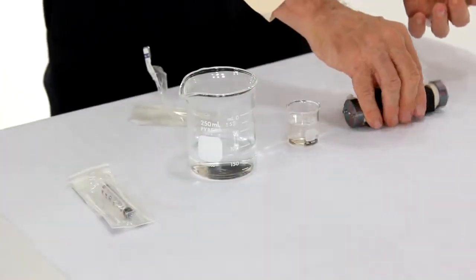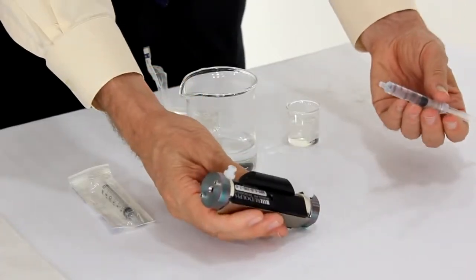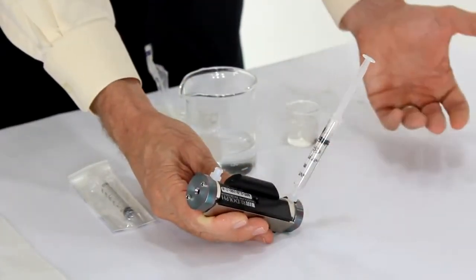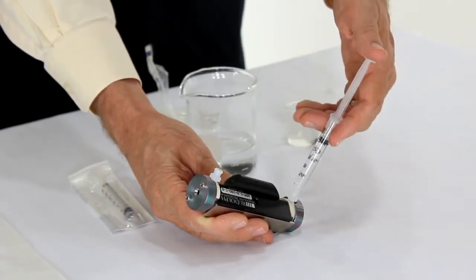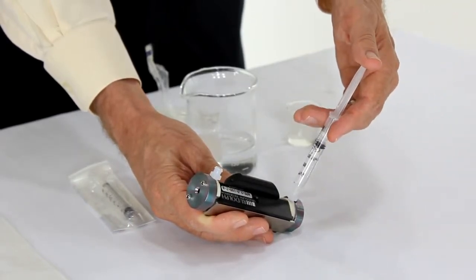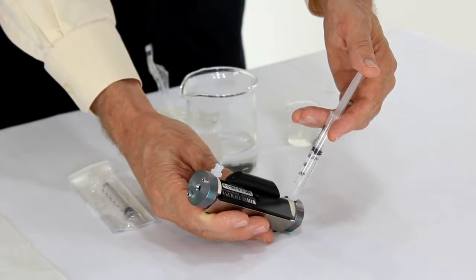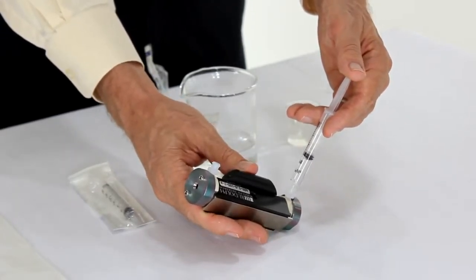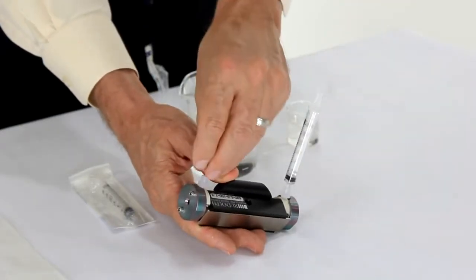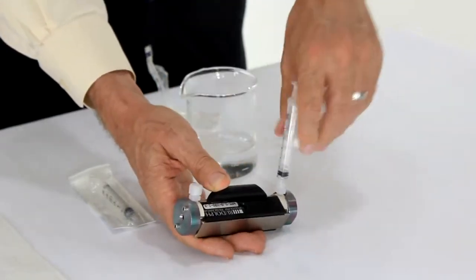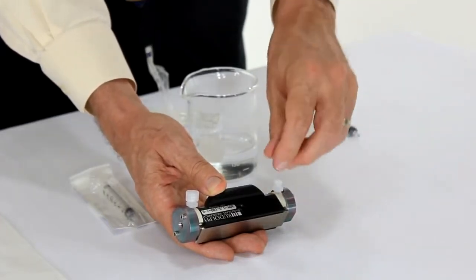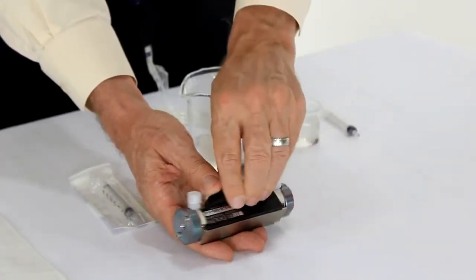I hold the cell in one hand, the syringe in the other hand. I make sure the top of the cell is pointing towards the ceiling and I place that inside there. I will now slowly inject the sample into the cell while looking at the end, and when I see the sample appear at the other end I will place a cap on the cell, place a cap on the other end of the cell, and now we're ready for measurement.